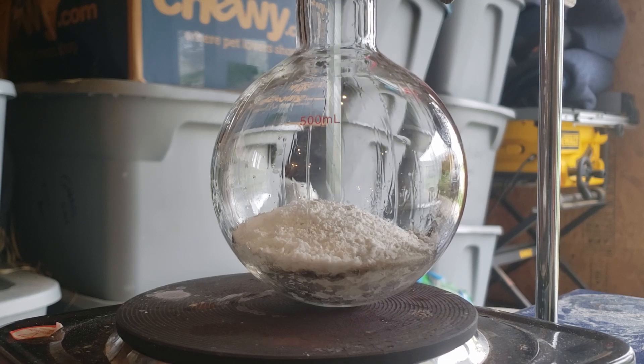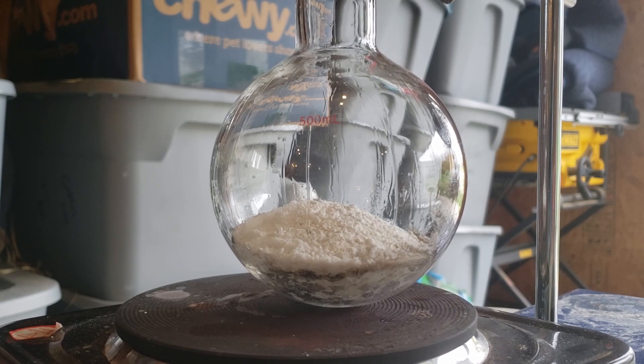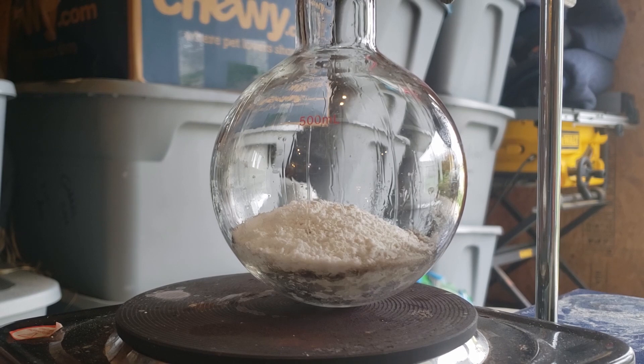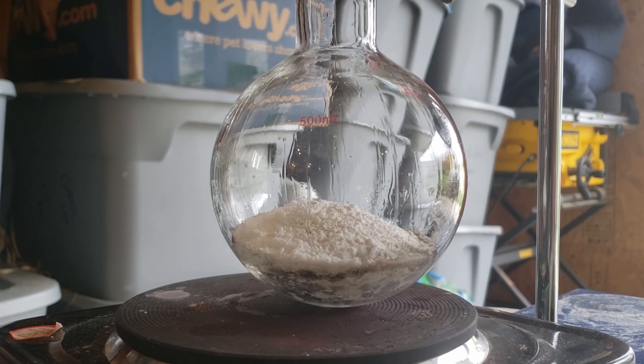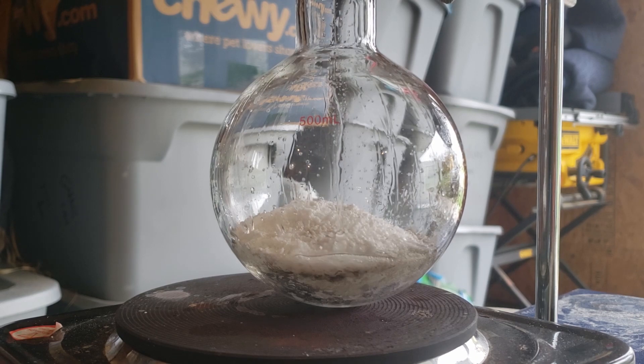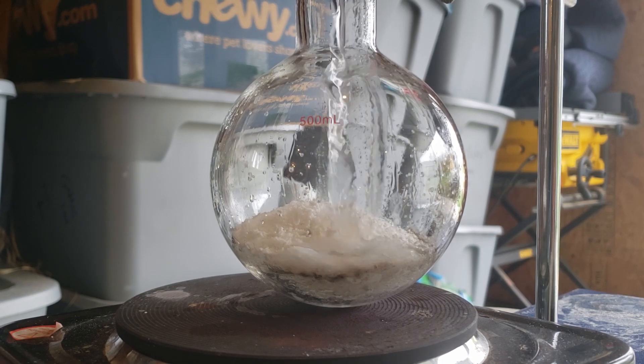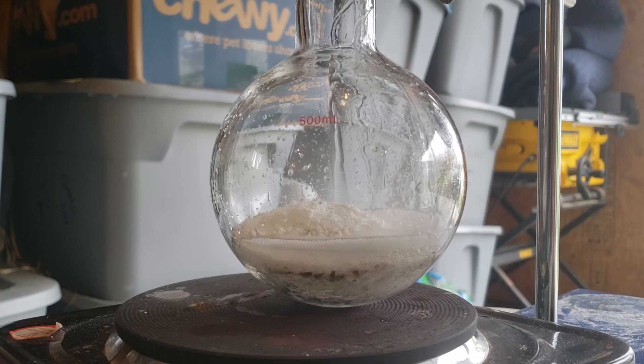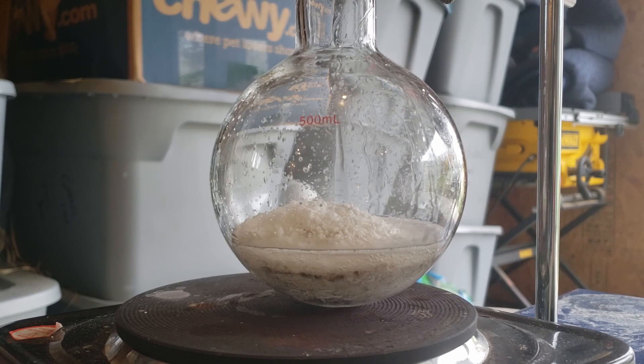To clean everything up, I used some sodium bicarbonate solution. As you can see, the reactants in the reaction flask formed a very hard brick of sodium sulfate and unreacted sodium bisulfate in the reaction flask, which was near impossible to remove.